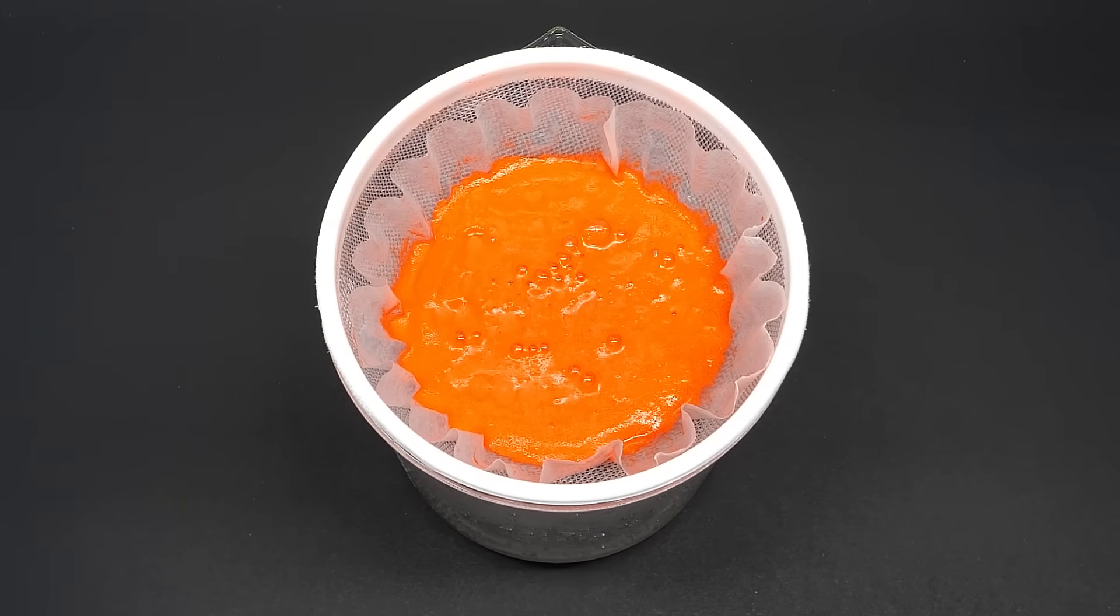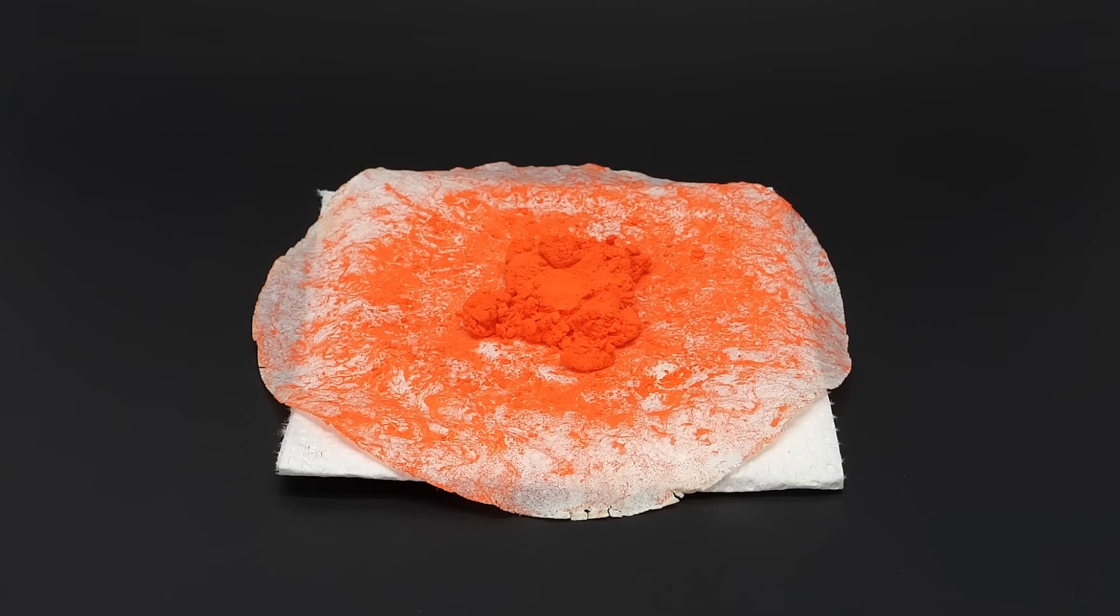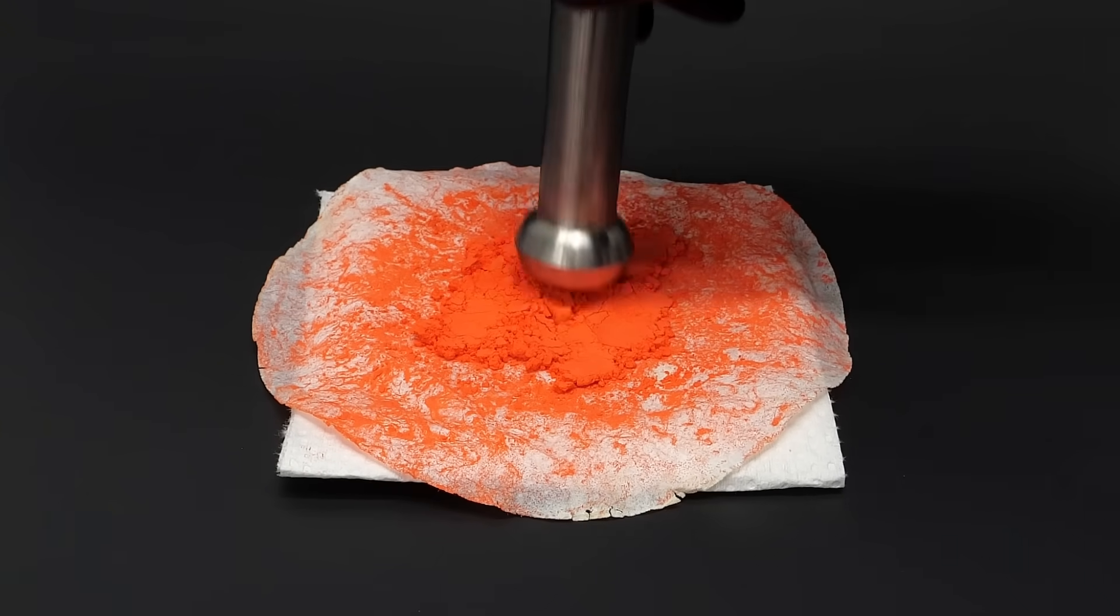I let it sit here for about a day to dry, and then I spread it out on some paper towel. A few days later, it looked nice and crispy, and I was able to crush it into a powder.